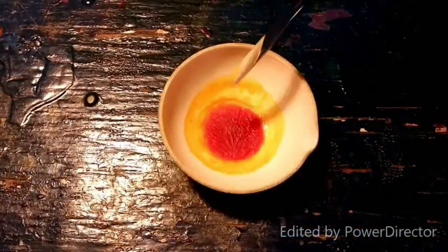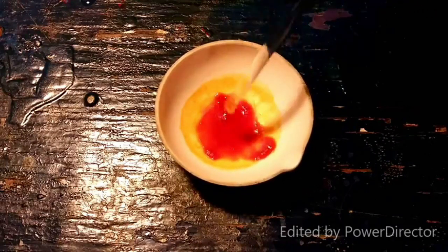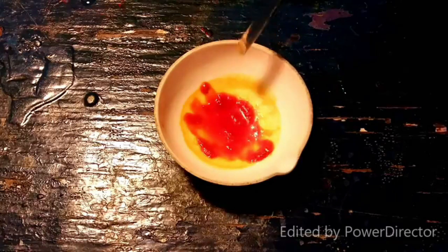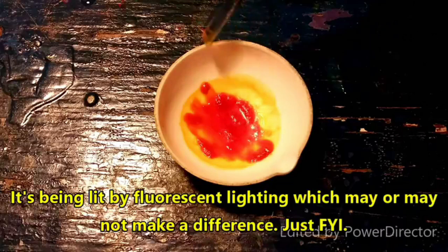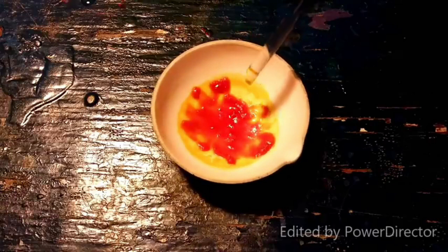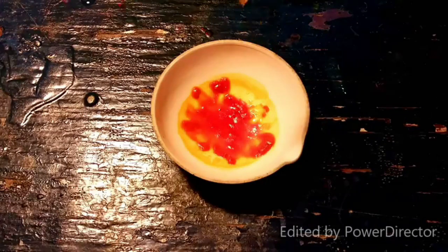Okay, everyone, so I've been evaporating this down here for a little while, and as you can see, it's almost dry. I think what's really fascinating about this stuff is how it is such a much more vivid red on camera than it is in real life. In real life, what I'm looking at is a kind of dullish, almost reddish orange, but on the camera, this just looks like it's bright red. That is just amazing. So what I'm going to do now is put this in the vacuum desiccator, and I'm going to let it completely dry out, and that will give us our finished potassium tetracyanonickelate 2. So very cool, huh?